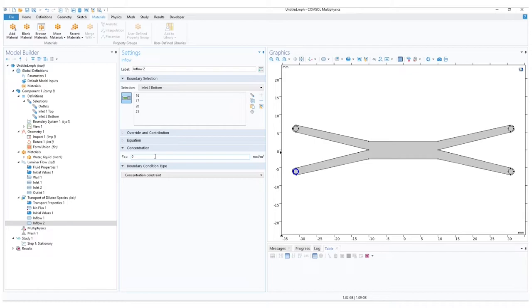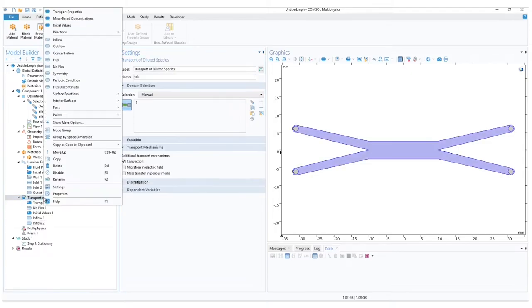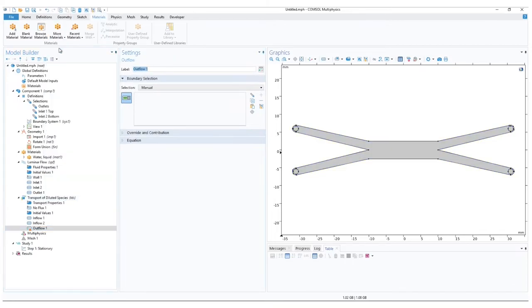and for the concentration, it has to be something different than the first inlet. It can be left zero. But to avoid possible computational errors with zero, let us set it to 1. Notice the unit is in cubic meters, which leaves this concentration still relatively close to zero in comparison to our C in. Lastly, for diluted species, add an outflow. Right click and choose outflow. There are no other settings here available other than choosing the boundaries.